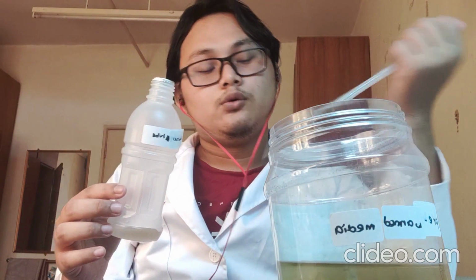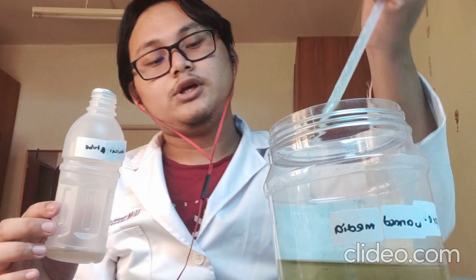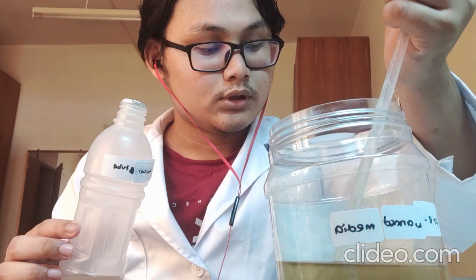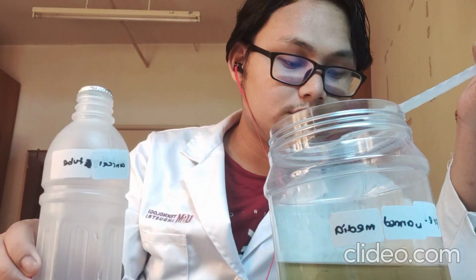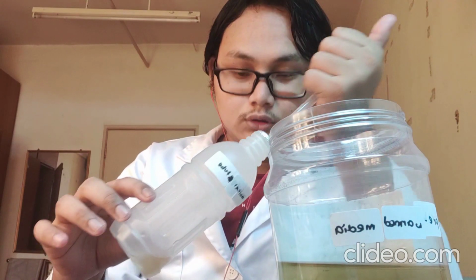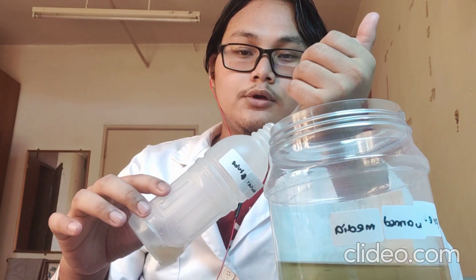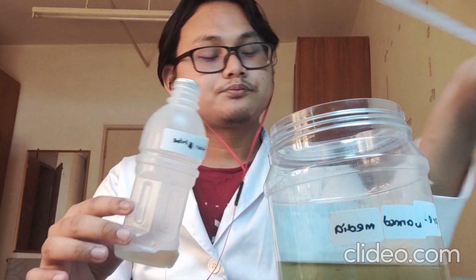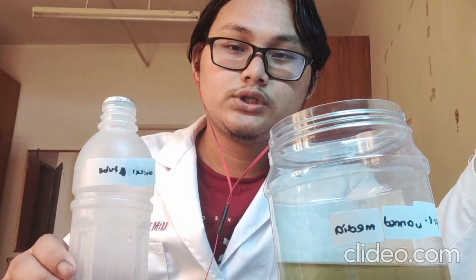Okay, after that, we will add 5 ml of fresh culture media. This is the fresh, pre-warmed culture media. We will add it. Okay, after we add the media, we will resuspend. Like before, we resuspend by pipetting up and down, up and down. Okay, after we resuspend the cells, we count the cells using the hemocytometer.